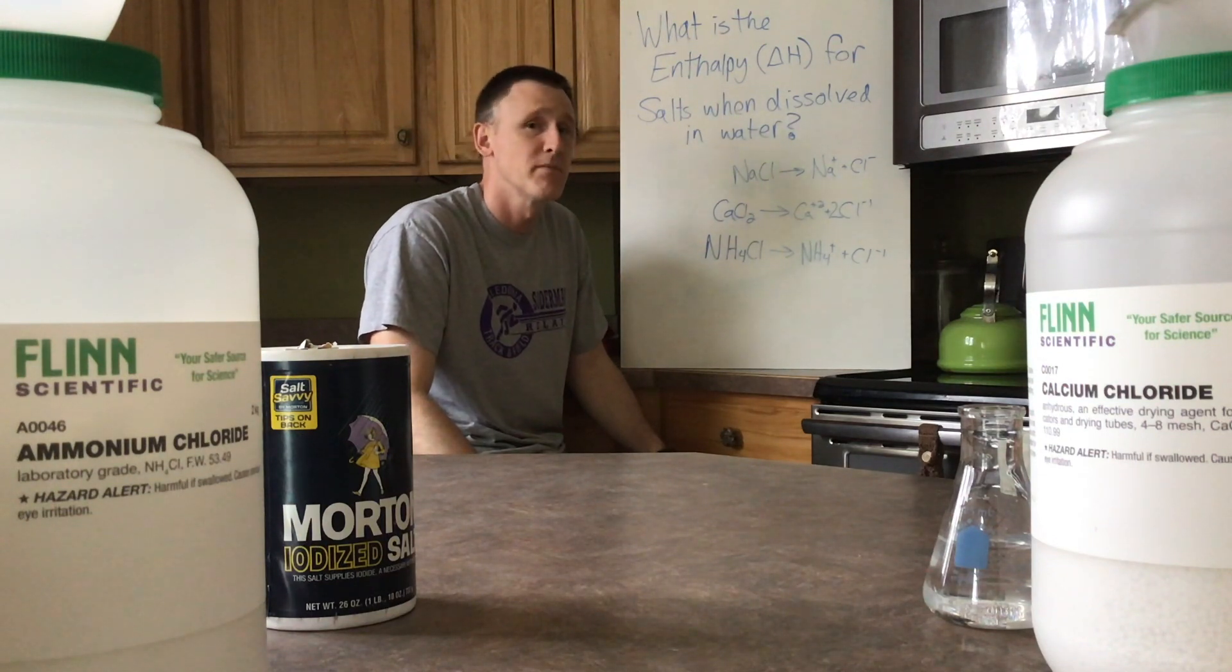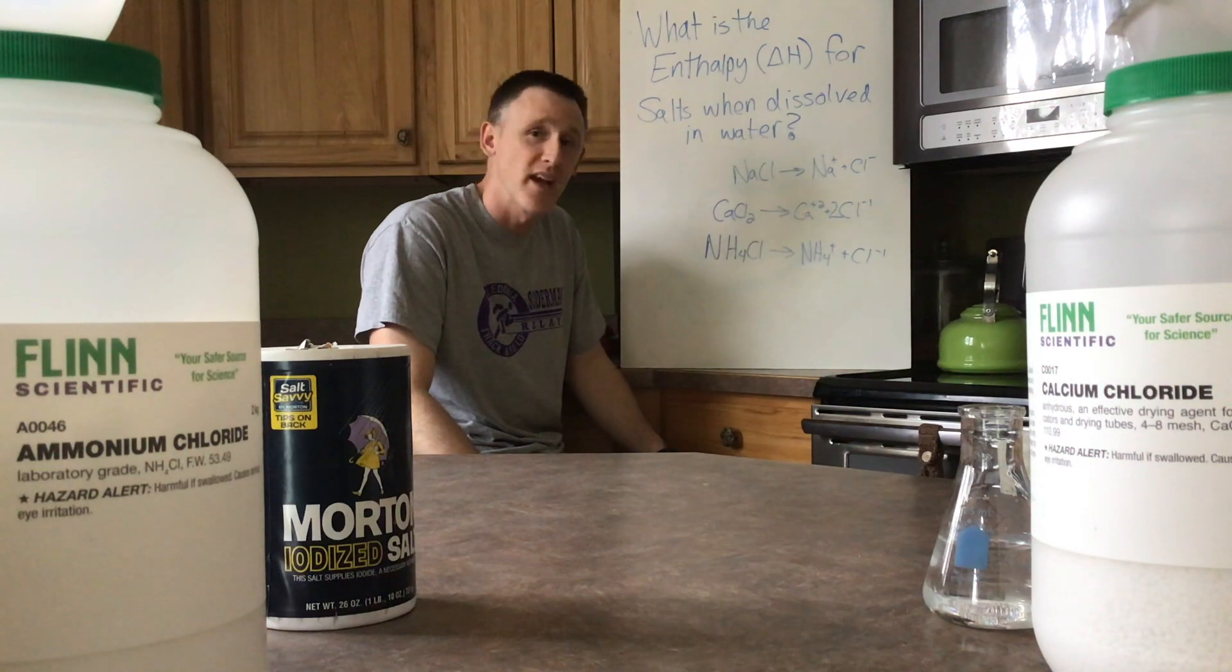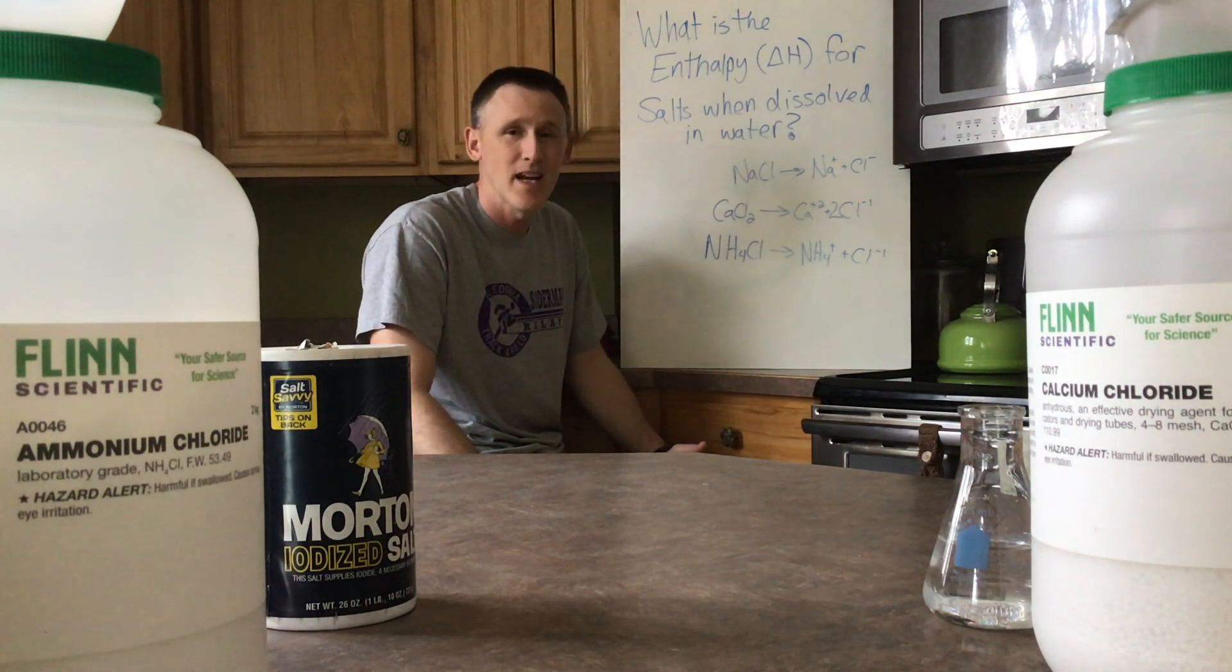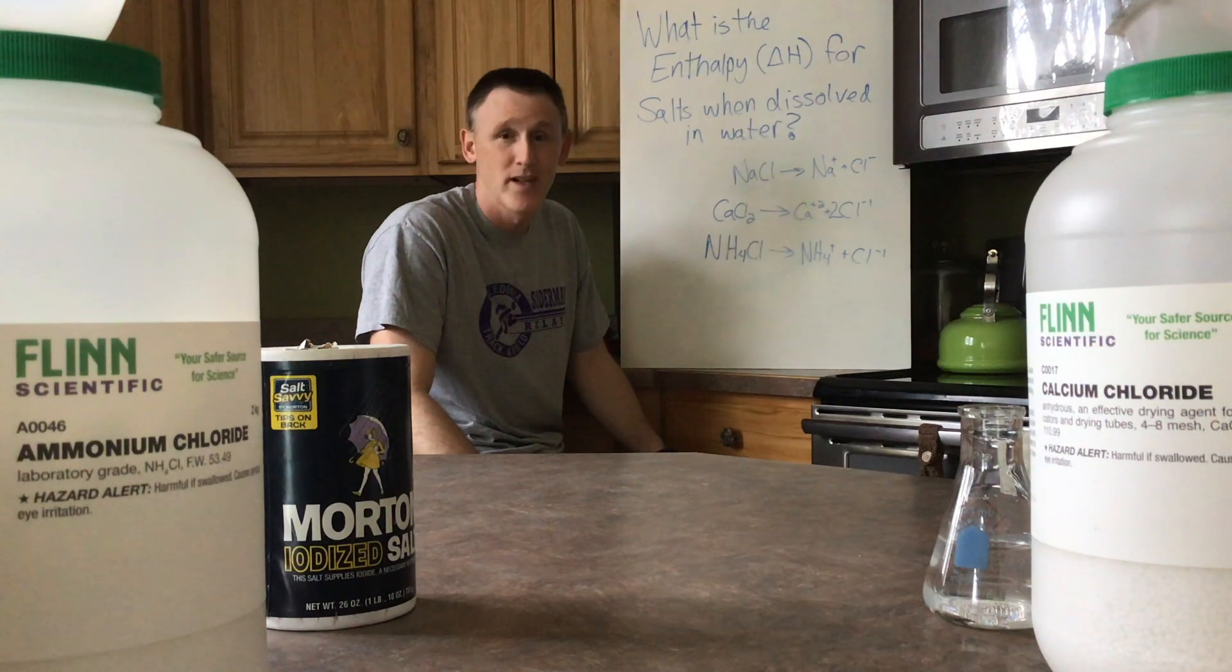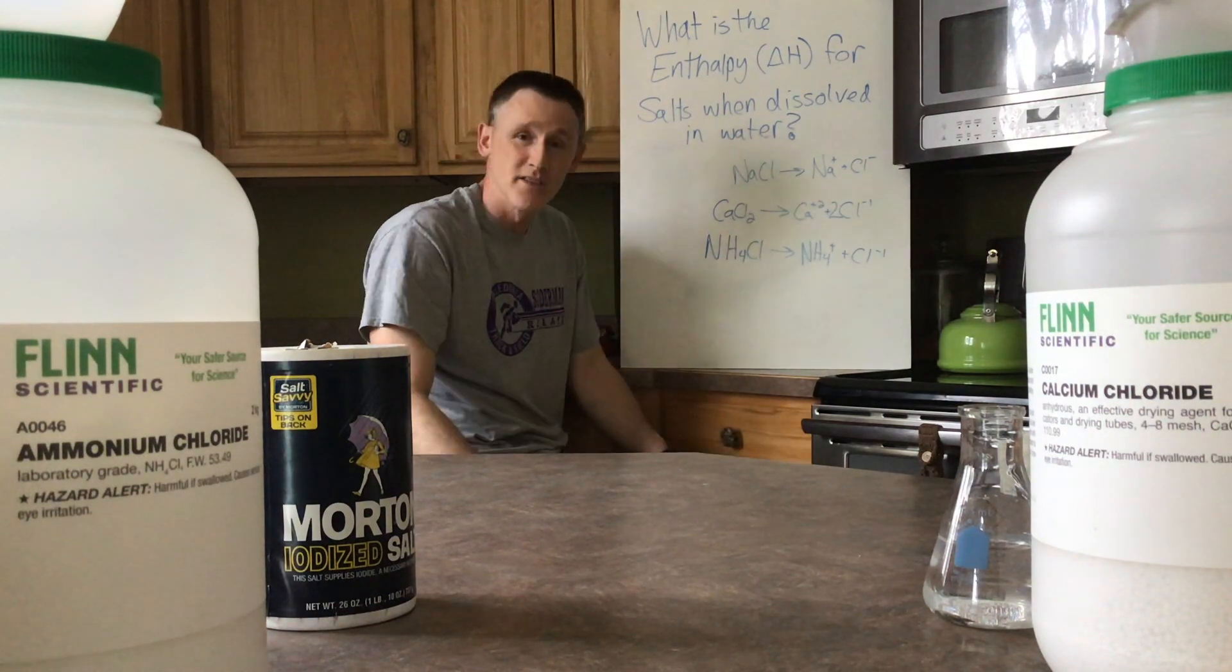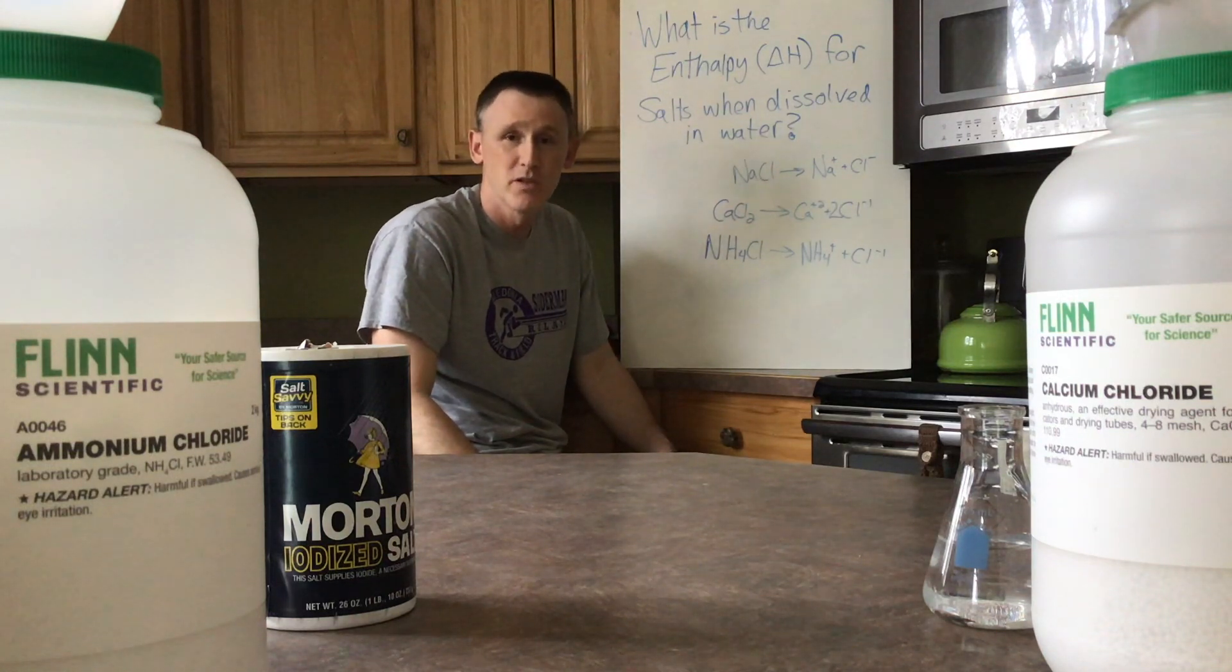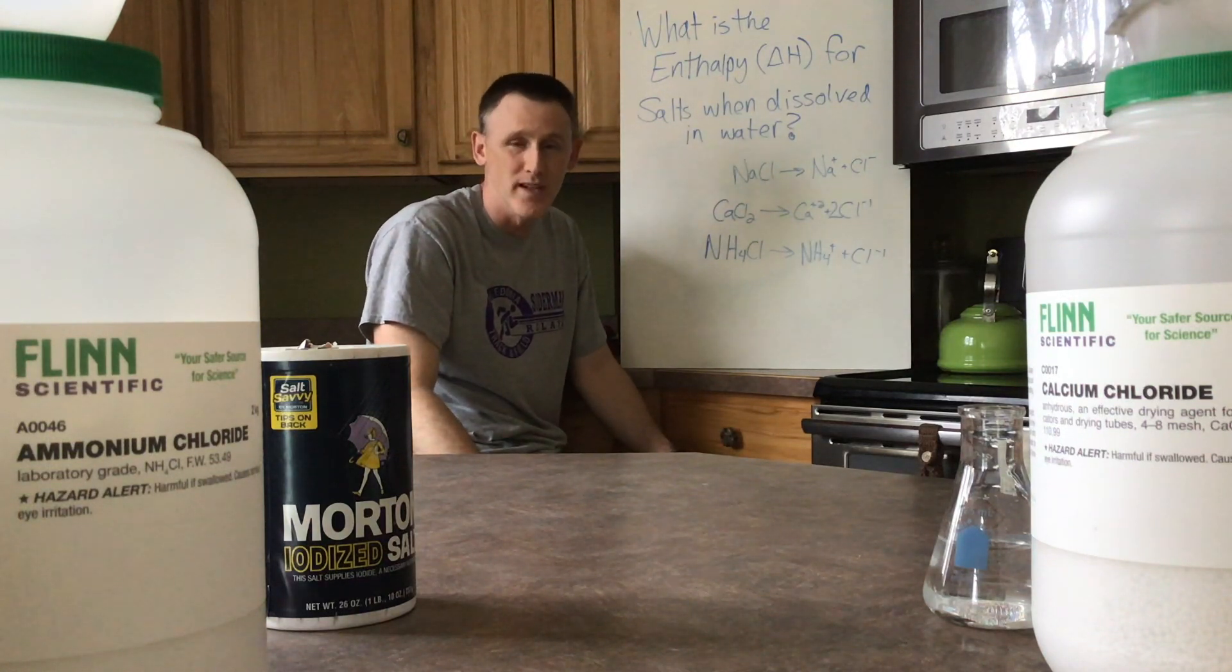Now you're used to hearing the term salt, meaning NaCl, and that is true, it is a salt. But we also have calcium chloride and ammonium chloride today as well. Anytime you have an ionic compound where you take a metal and a non-metal put together, we generally categorize those as salts. So we're going to go ahead and do this lab. I would like you to pause the video to record your data as we go through this experiment.